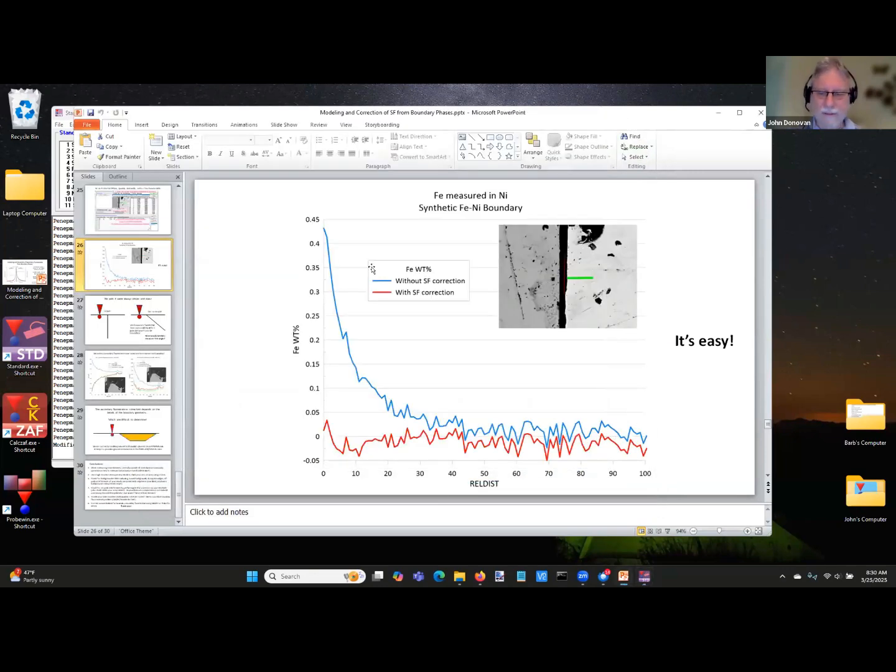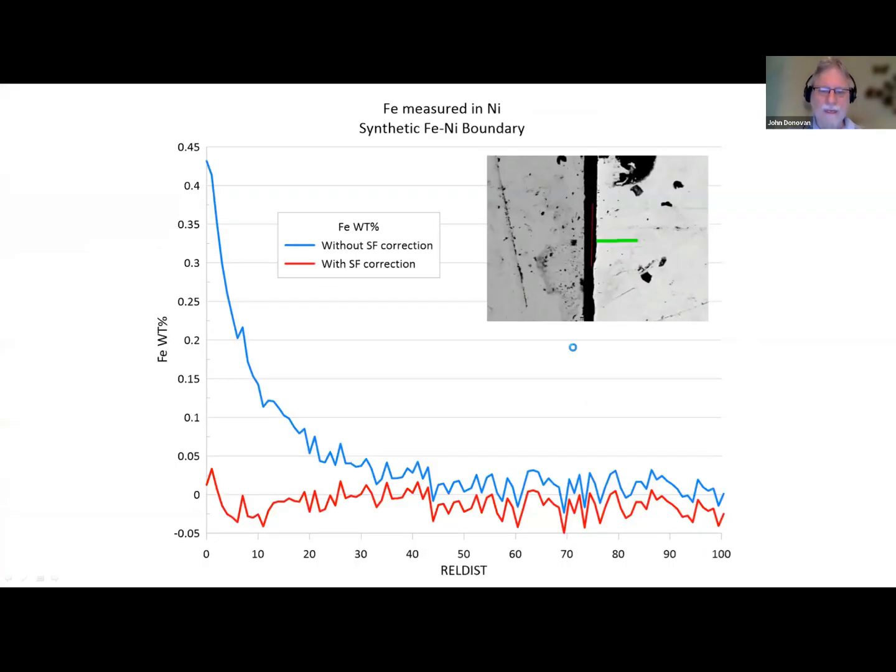Okay, let's go back to here. So in this case, I made a synthetic iron-nickel boundary. It's really tough to do this where you polish these things separately. So this is the pure iron, this is the pure nickel. I measured iron in pure nickel adjacent to iron. It's about a 30 micron gap here. We just couldn't get it any better than that. So the boundary is kind of somewhere in the middle there. And you can see without the secondary fluorescence correction, we're getting up to about 4,000 ppm. And with the secondary boundary fluorescence correction, we get essentially 0. So this works.